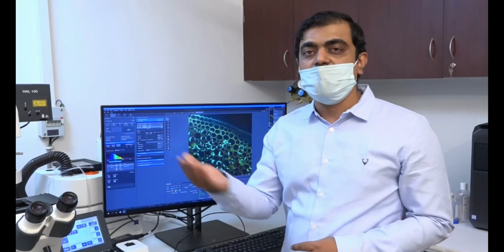And in this, if I go to the gallery, these are the slices. So you can see 1, 2, 3, 4, 5, 6, 7, 8, 9, and 1, 2, 3, 4, 5. So this is how much? If you see in the Z, it is 47. So 45 and 2, 47. So 47 slices we are getting for each channel for red, green and blue. And if we do orthogonal view, we can see each and every, like this is an XY plane which we are getting, but this is an XZ plane which will give the thickness idea, and this is a YZ plane.